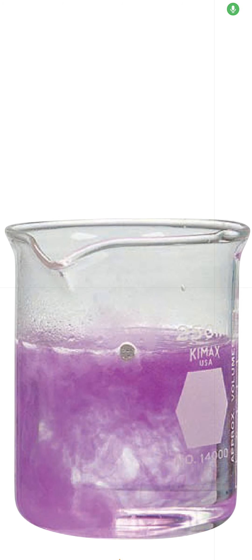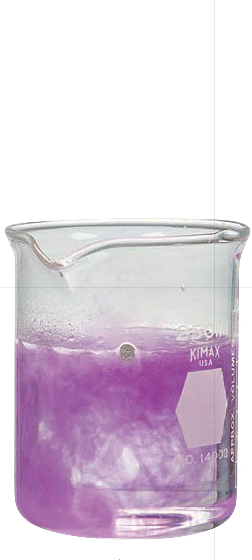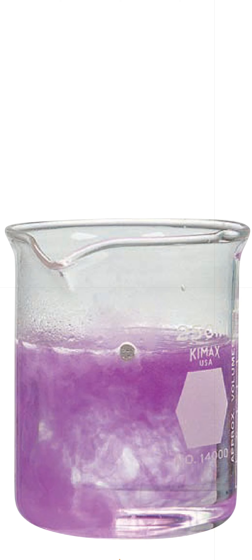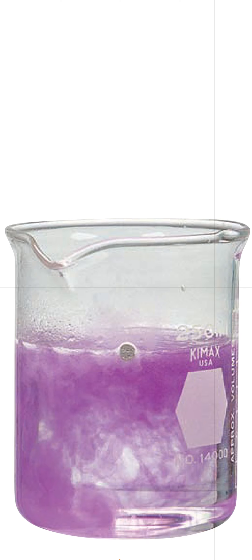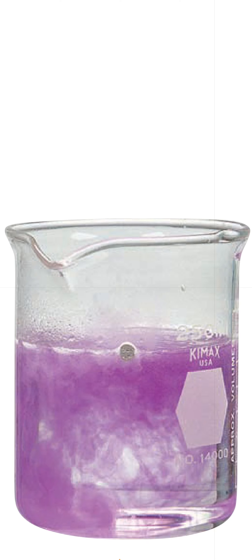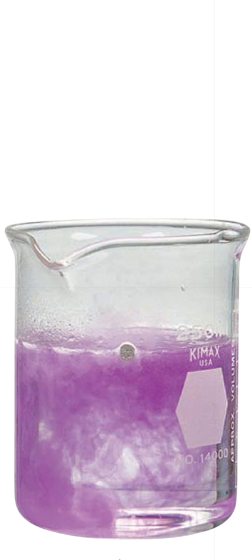Hello friends, you can see in this reaction the pink color of the beaker and how this reaction occurs.